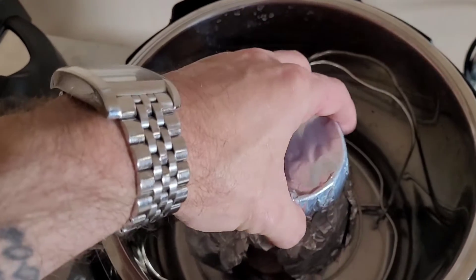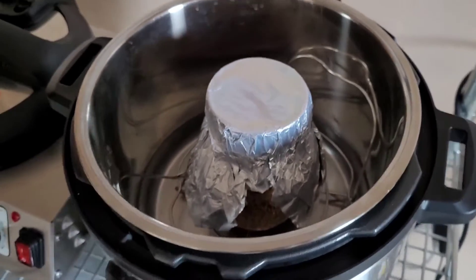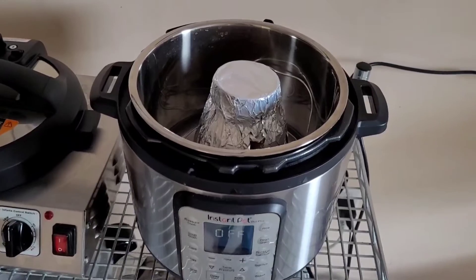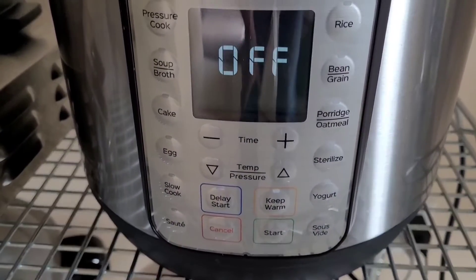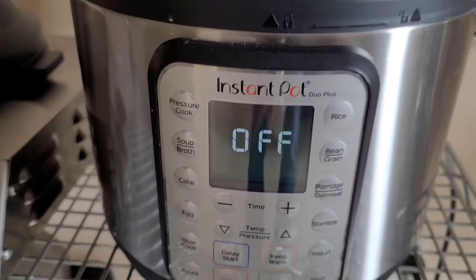I have three cups of water in here. I'm going to be running that on the wire trivet. This cycle is going to be for 90 minutes as opposed to three hours. I'm going to set this on the max pressure, pressure cook, and we'll see how this goes.